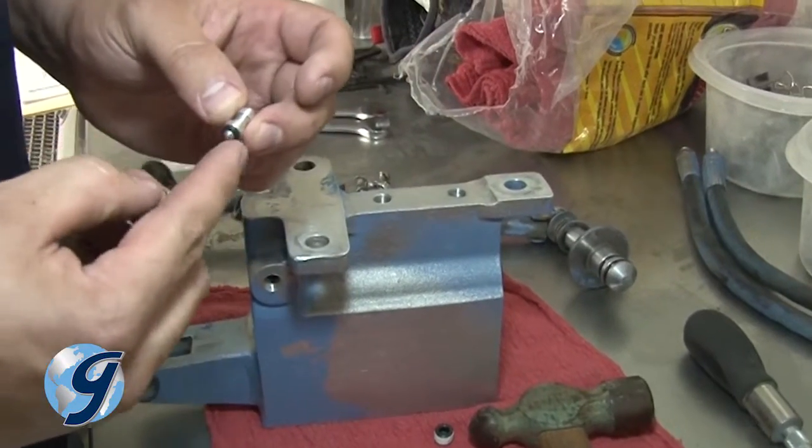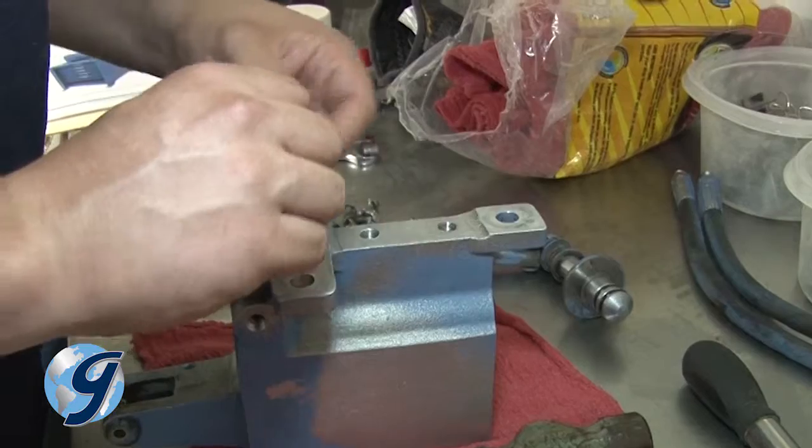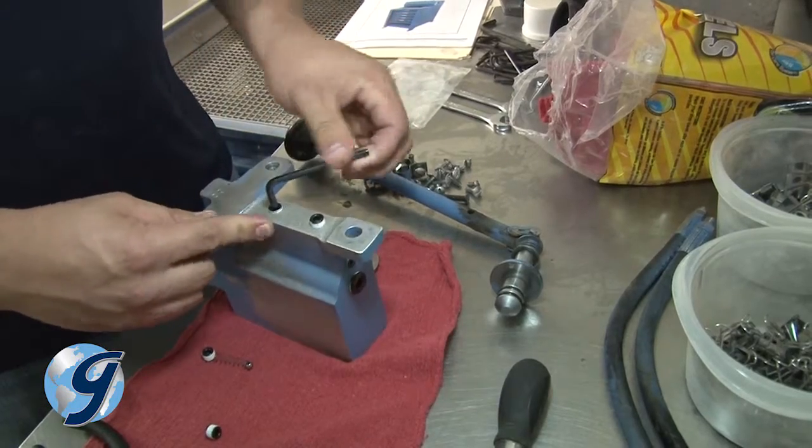Next, fit the pressure check O-ring on the pressure check release pin and install it on the underside of the pump. Followed with a slightly thicker and shorter pressure check spring, and then finish with the new plug.